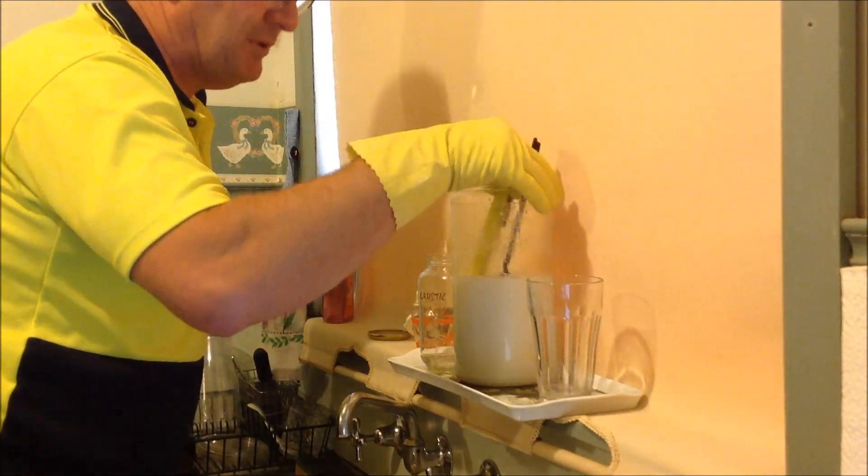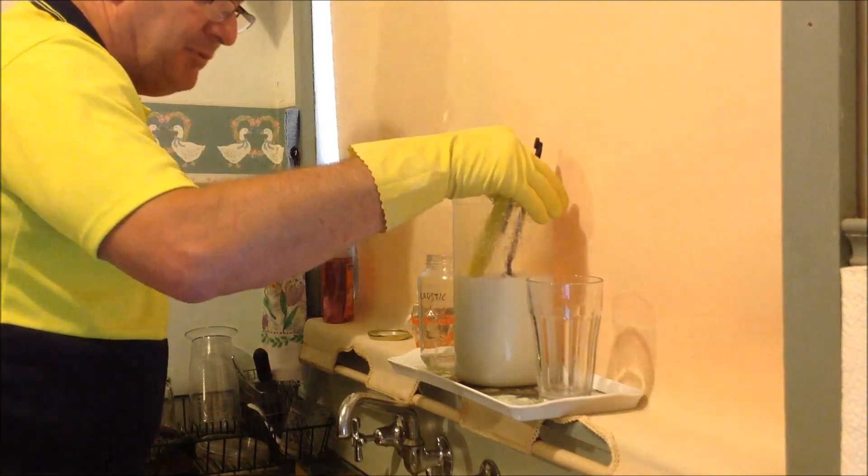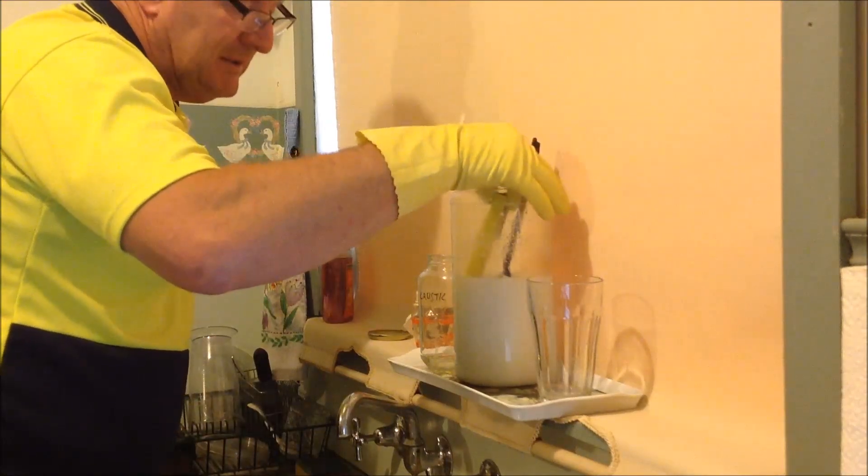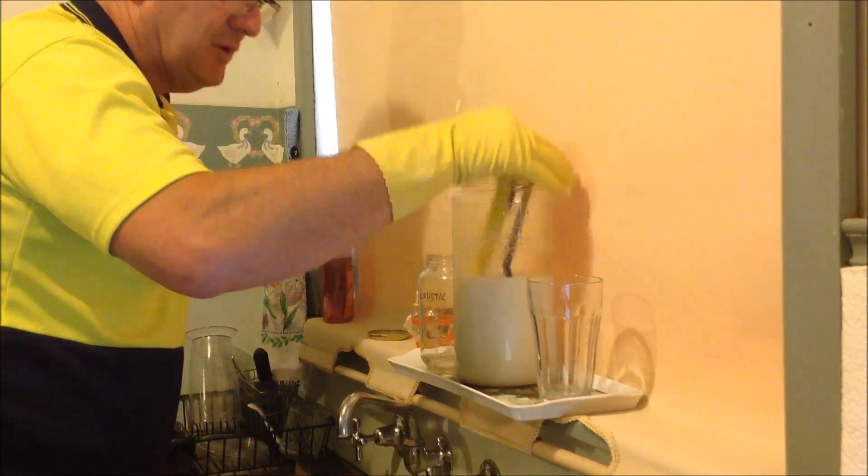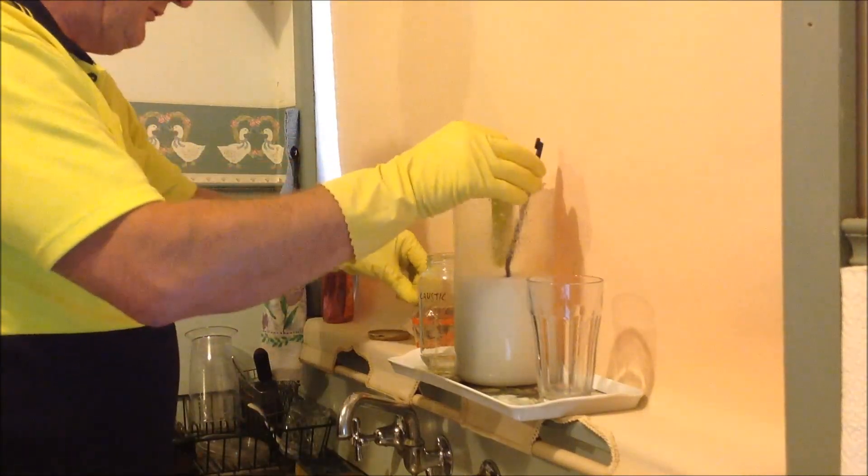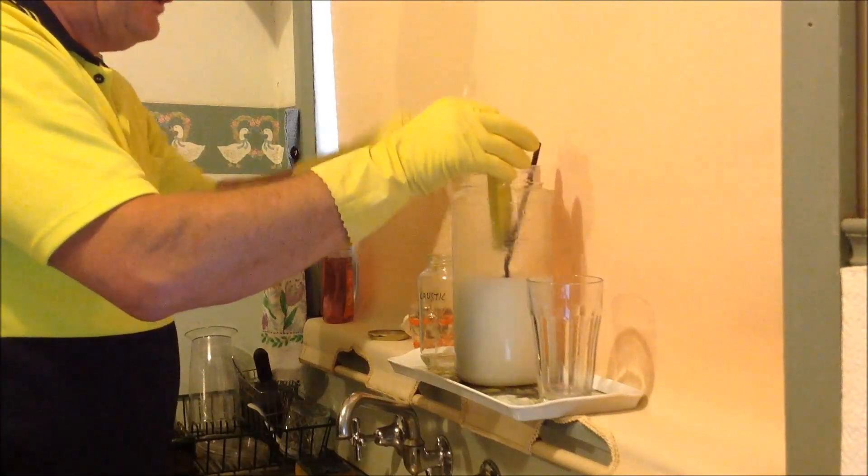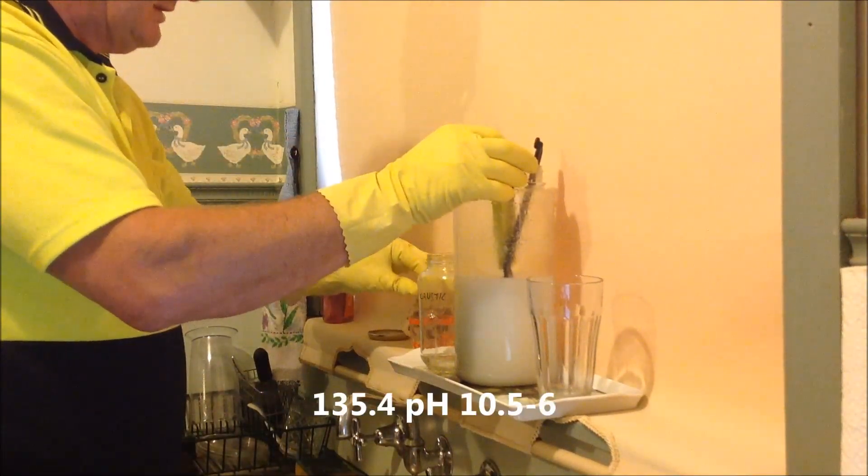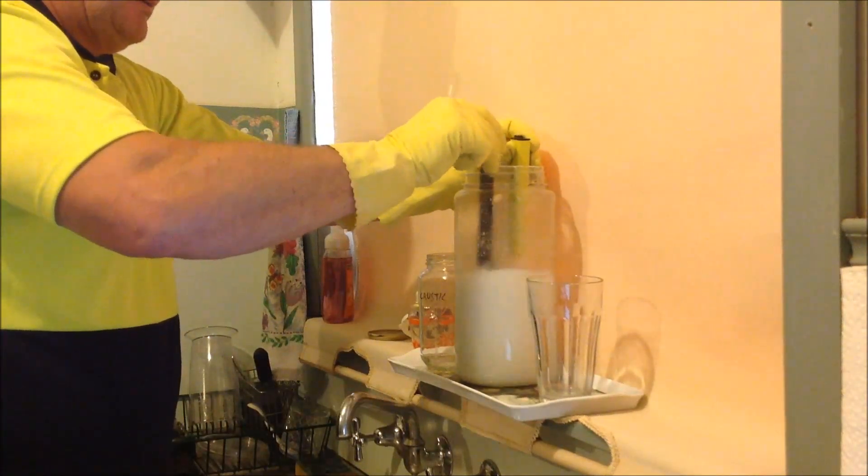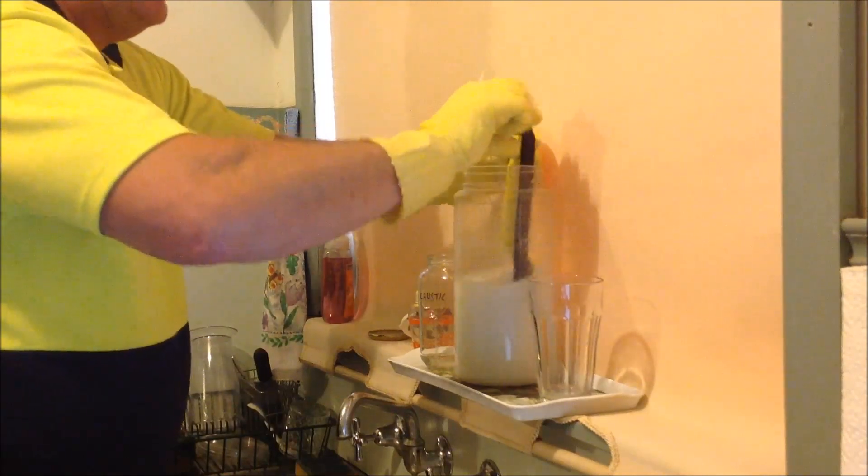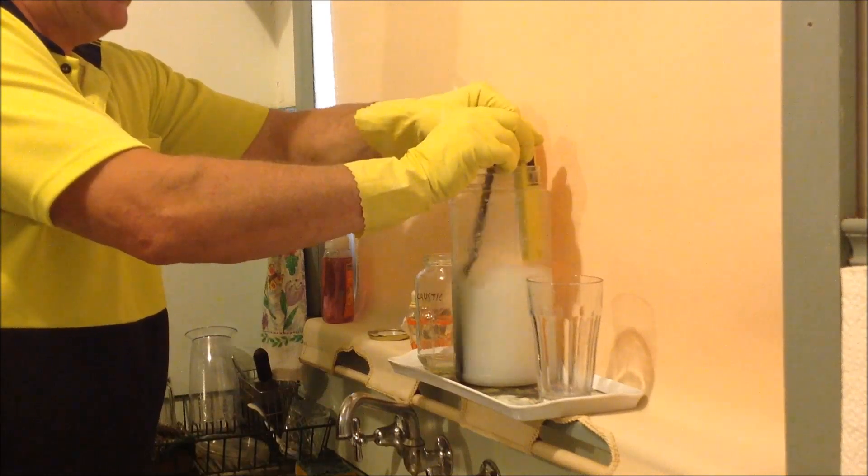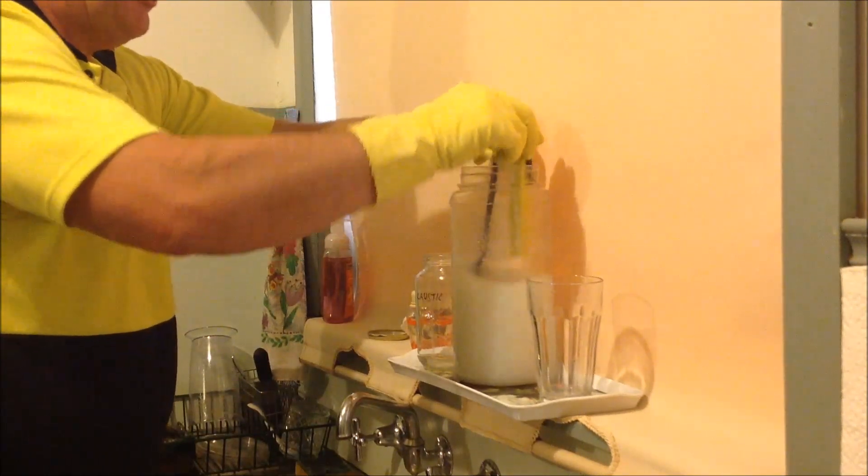And if you see it going up, you might really have to put some acid in to bring the pH back down, and that's where you need some 10% acid as well. You don't want wild swings, you just want to be able to control the reaction. So we're fluctuating 10.6 and 10.5, so we're having an influence. Another 0.1 in. I think we're up to 5. I won't bore you to tears, I'll just chuck away at this. I'm going to keep it at 10.6 to 10.7 until it stabilizes.